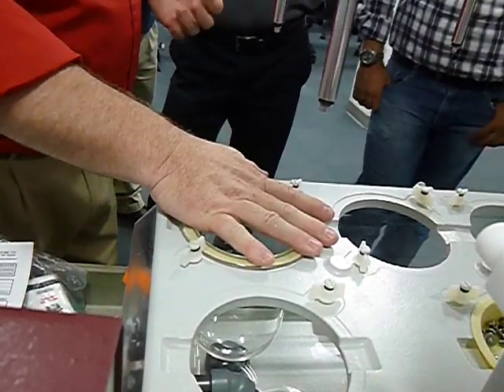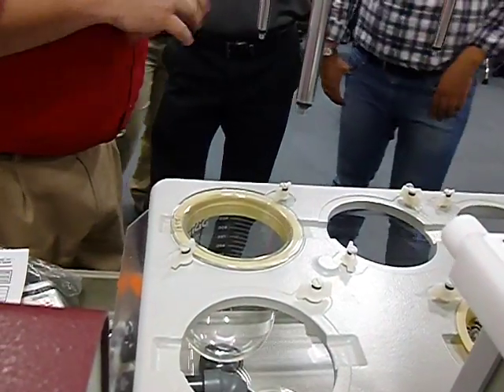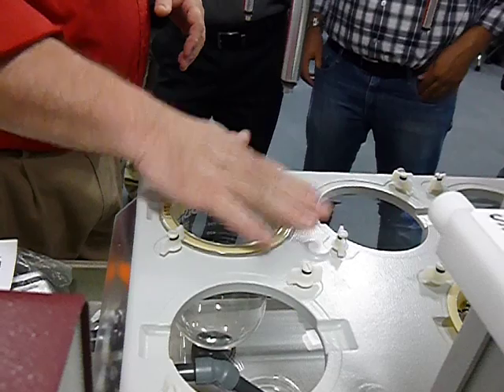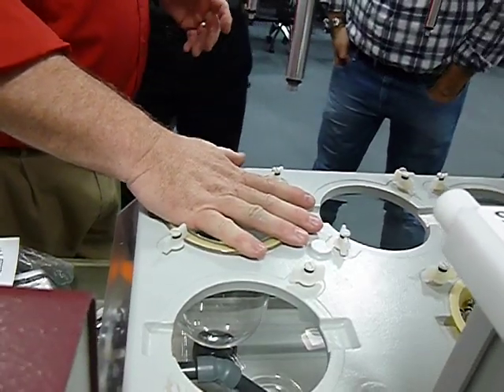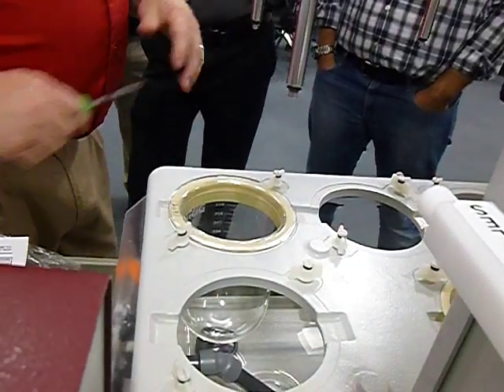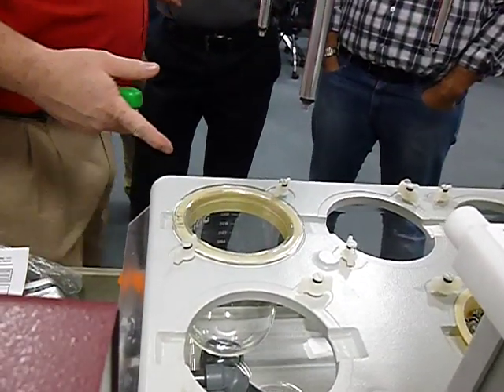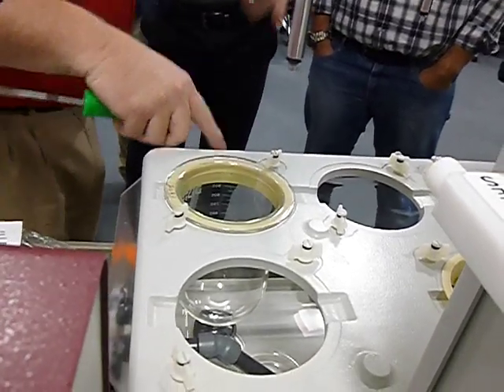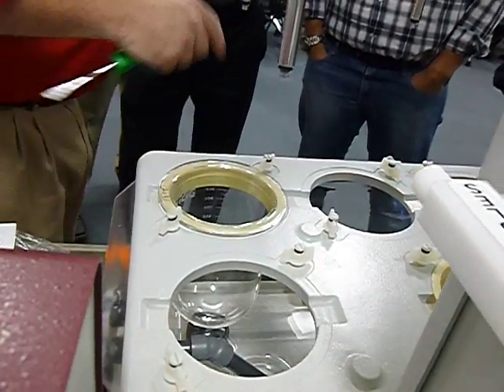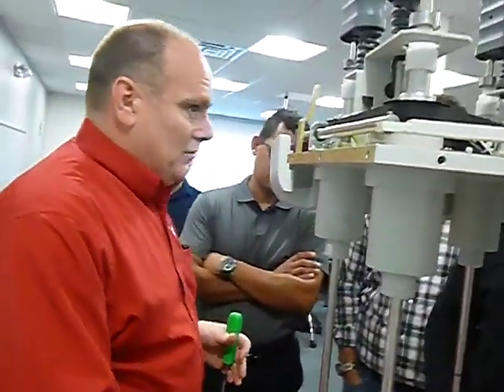Because when you're running a chemical test, these get filled up with media. And that media is going to help settle it down inside the bath also. All these are here for is basically just to hold it in place so it doesn't go anywhere. There can be some movement back and forth. Most labs have a tendency just to over-tighten these. Tighten them down, and then when you come out there, sometimes they snap, sometimes they're broken, sometimes they're like what we just found there with the nut too tight, and it's causing problems, because most people think it's supposed to hold it to make it not move. That's not the purpose. The purpose is just to hold it in place.